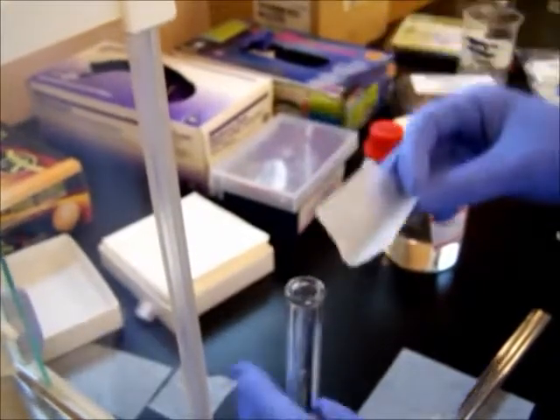It's never going to be perfect, but it's about as close as we can get for our purposes.